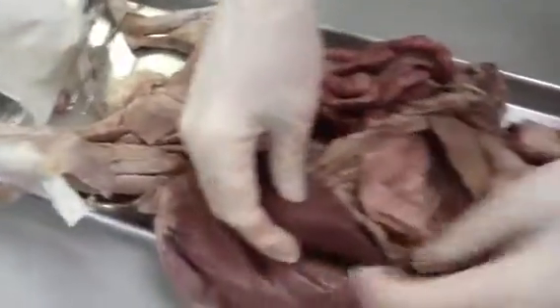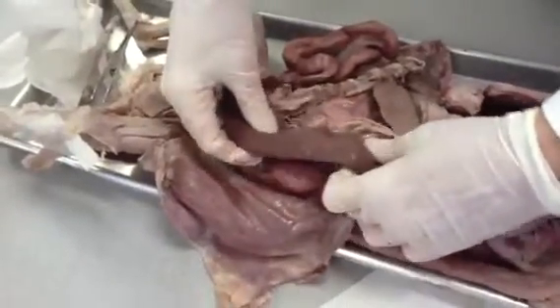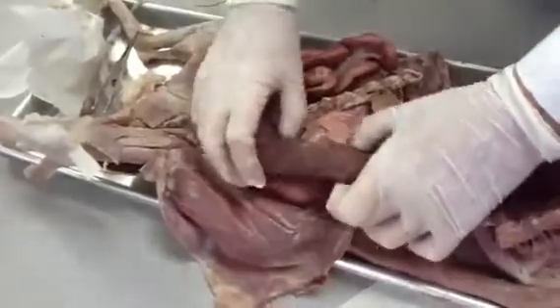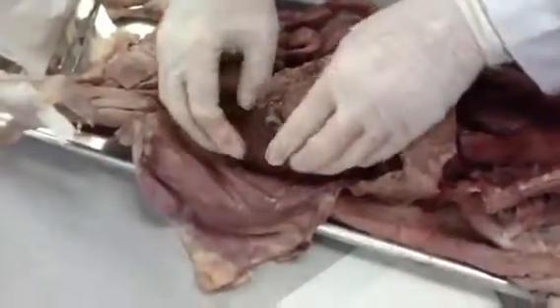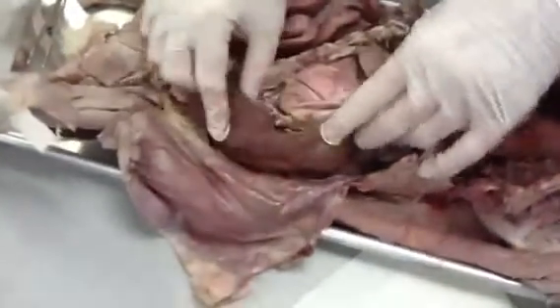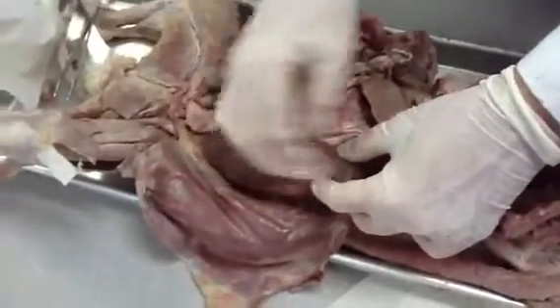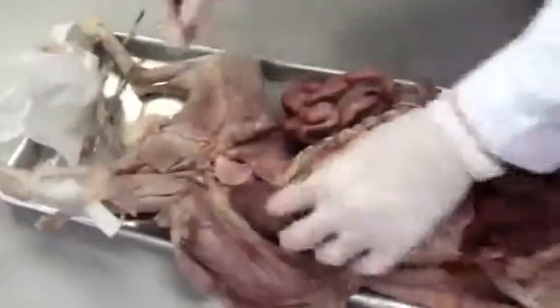And the last organ here on the left-hand side is this large, dark, very firm organ here. This is the spleen. This stores red blood cells, makes some red blood cells, has an immune system function. It's off on the side quite often. People, like in football injuries and car accidents, may have a bruised spleen, or it may actually have to be removed. You could survive without it, but since it has such an immune response, you have to be careful with your immune system afterwards.